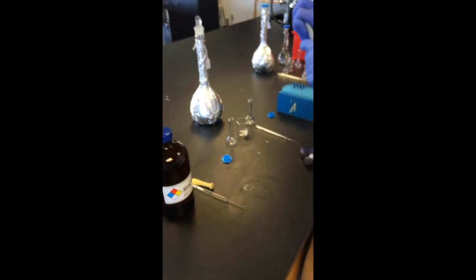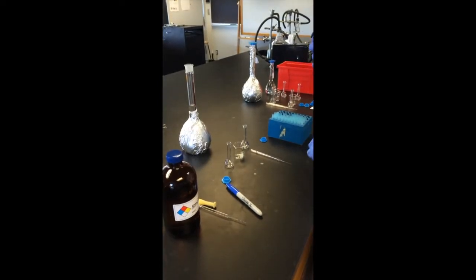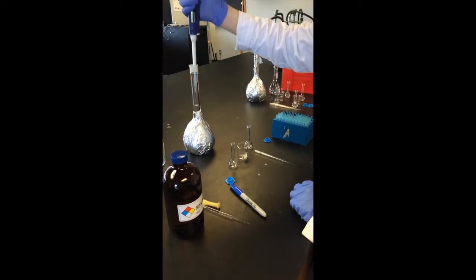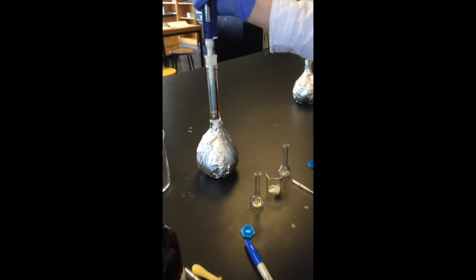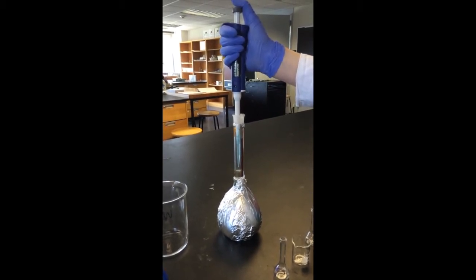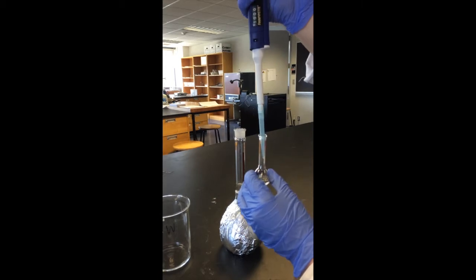So, the next thing you want to do is put a tip on your micropipette. So you're going to take 1 milliliter of your sample from your large volumetric. So I have put the tip onto the micropipette. I'm going to insert it in just so it's barely touching the solution. Put it down, push down to the first stop, slowly release and take up 1 milliliter, make sure there are no bubbles within, and then take my 10 to the minus 1 dilution, put the micropipette in, and push down to the second stop.